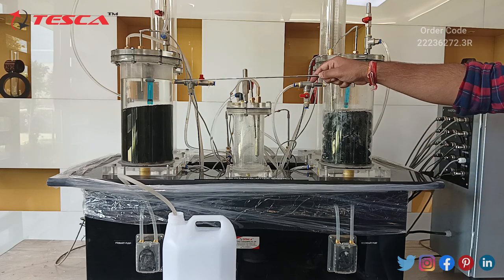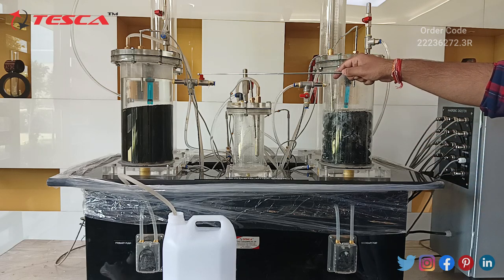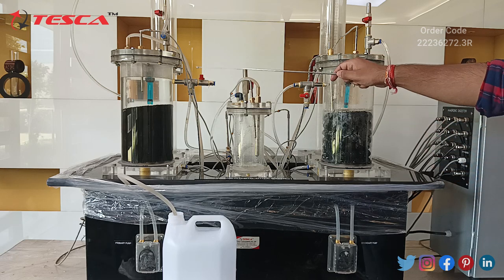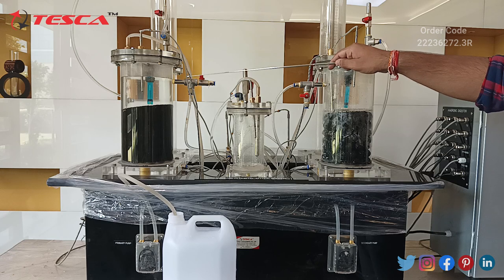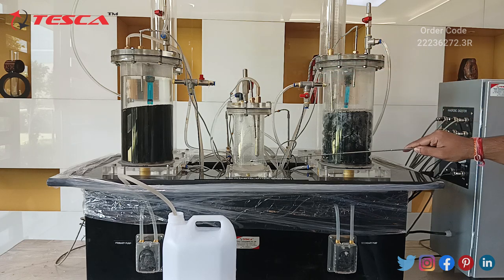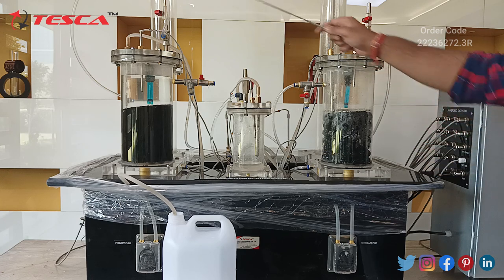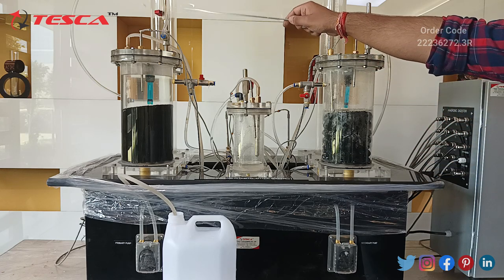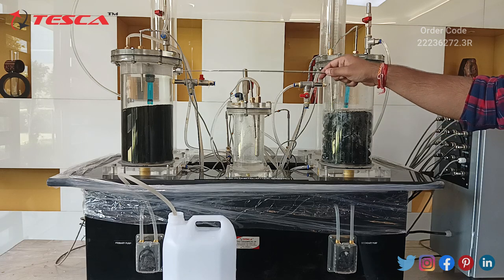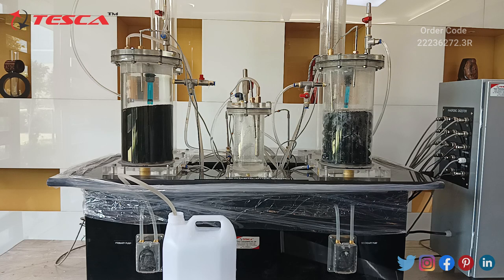Now as we can notice, our water level has reached up to this valve. We will have to open this valve and keep the other valve closed so that the water moves through this pipe and fills the intermediate tank. We will also make sure that the gas valve is closed so that when gas is generated in this column, it will not escape.